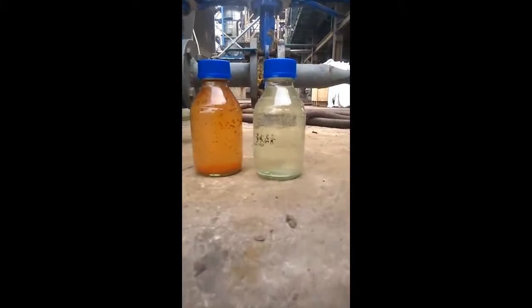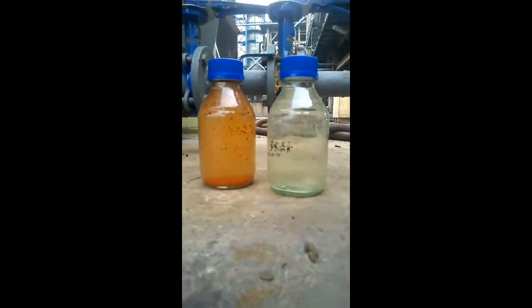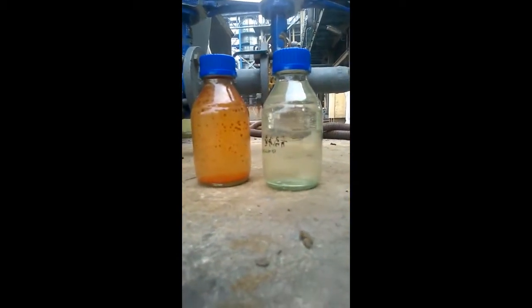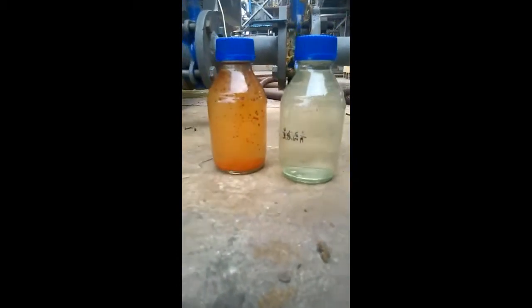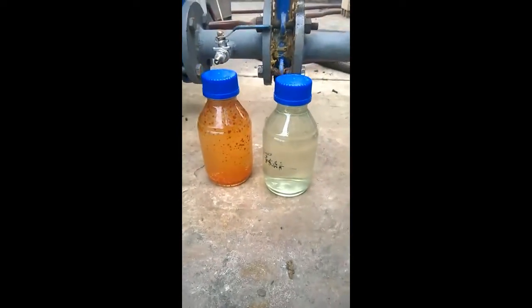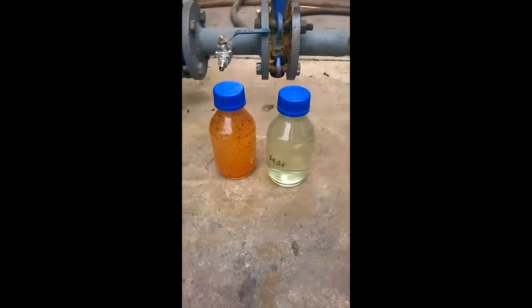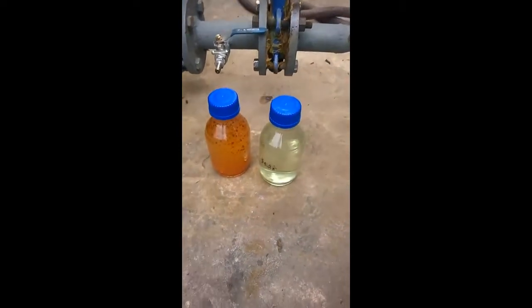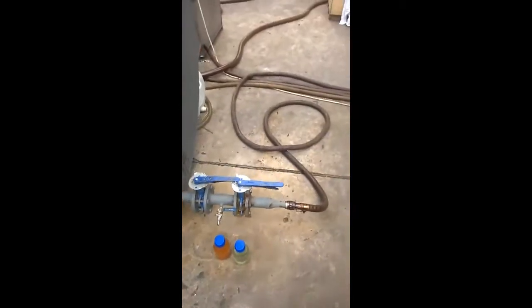If you would like to request that spreadsheet, please call us at the number shown at the end of this video. So there are the samples — raw water going in, and treated water after the replaceable membrane skin layer membranes.